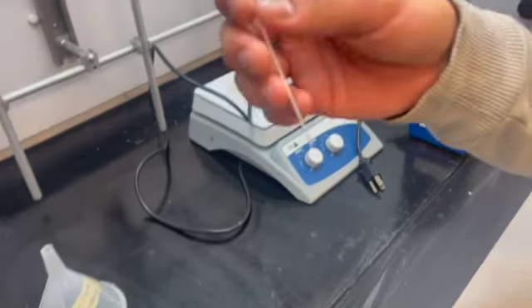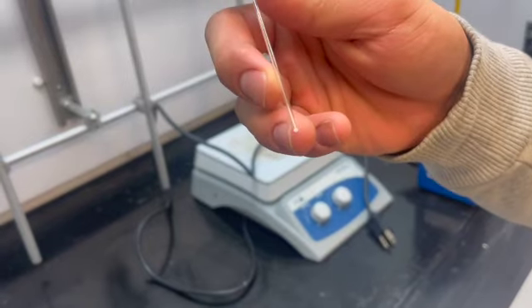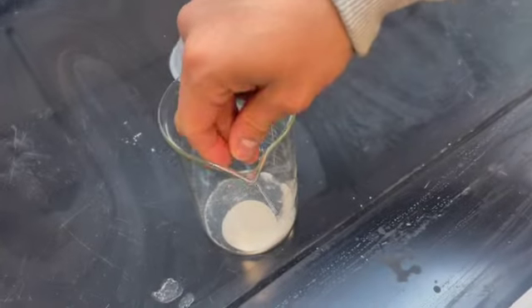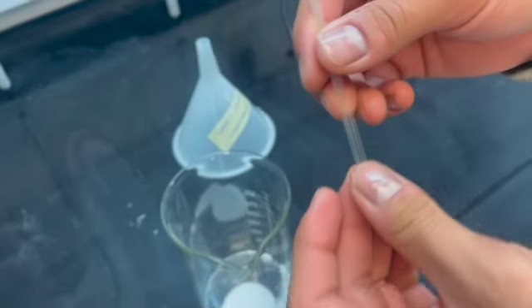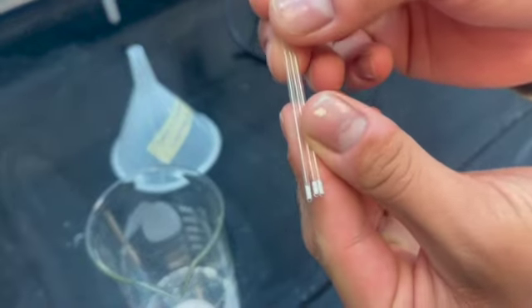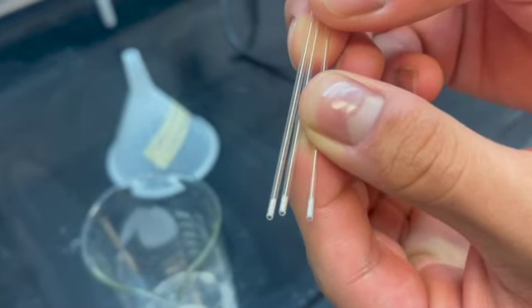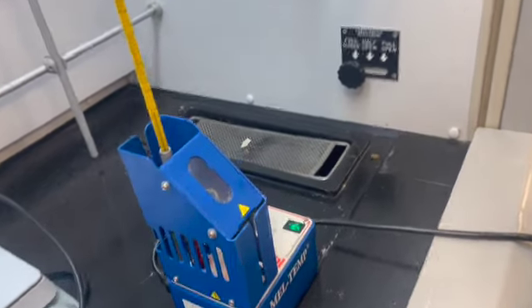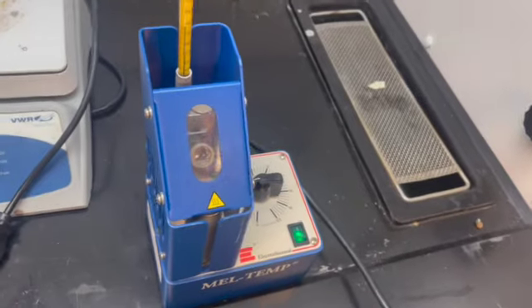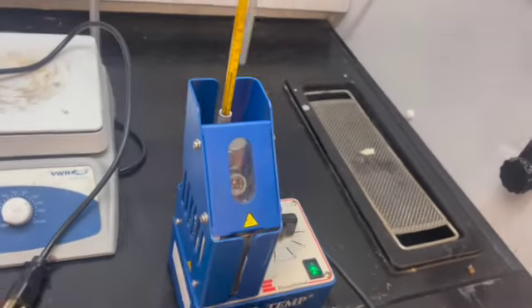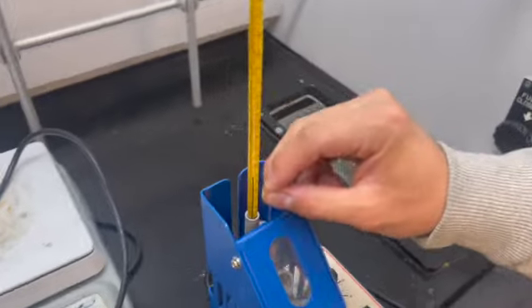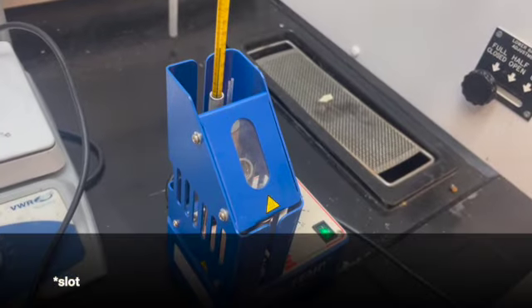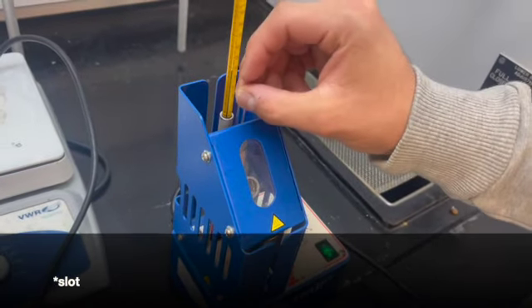We'll grab a capillary tube and try to fill it up with only a very small amount. After a few minutes of trying, we'll get 3 capillary tubes with this amount of solid inside. Pre-heat your melting point machine up to 2.5, and then we will place our capillary tubes inside the machine. Make sure they're in within each little slot. And now we wait.